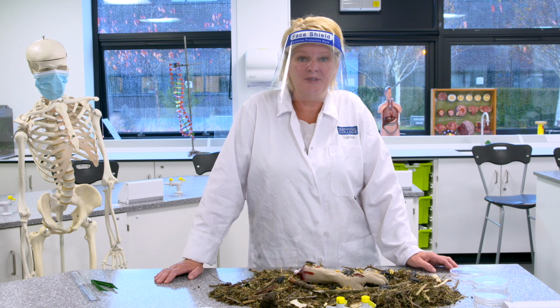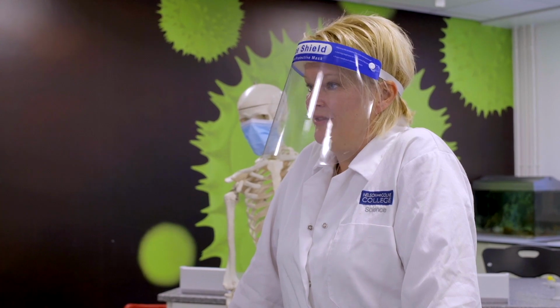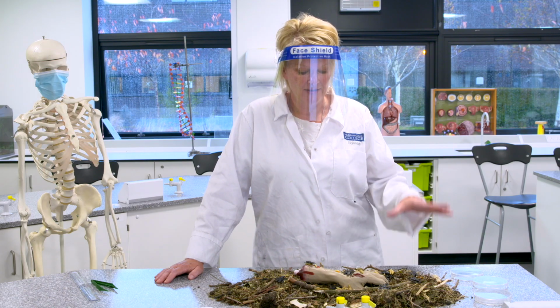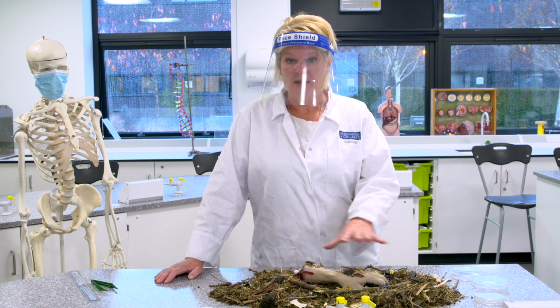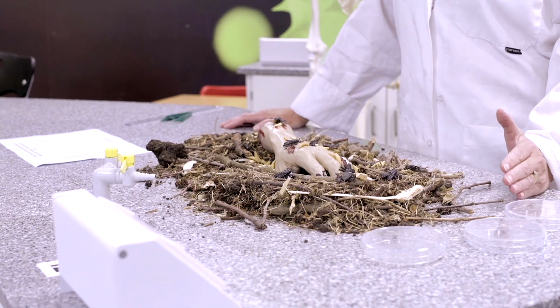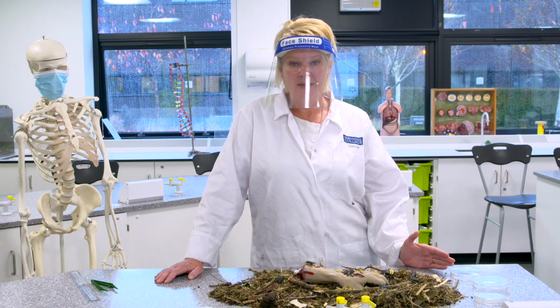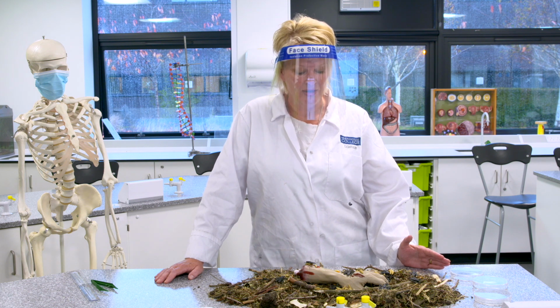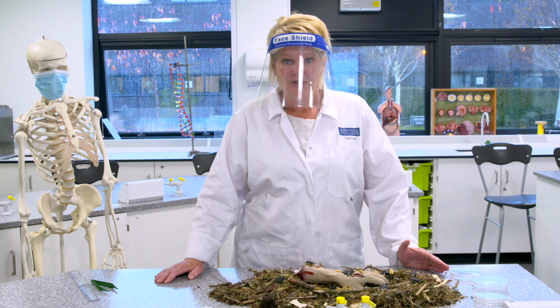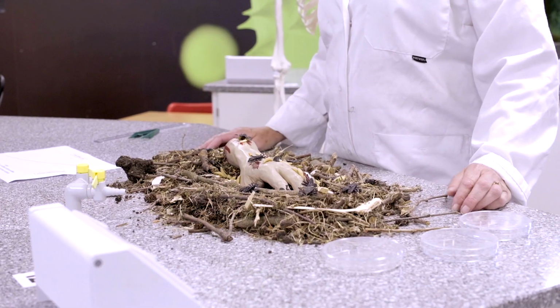The forensic practical I'm going to show you is called forensic entomology, and entomology is the study of insects at a crime scene. So what we've got here is a body part found at a crime scene. And one thing we need to know is how long has that body part been there? Well, entomology enables us to estimate what we call a time of death, to do with the insect activity that we've got around the crime scene.